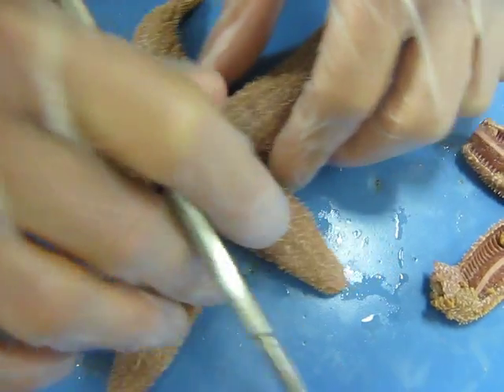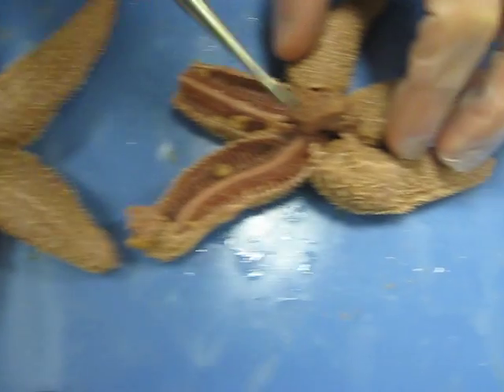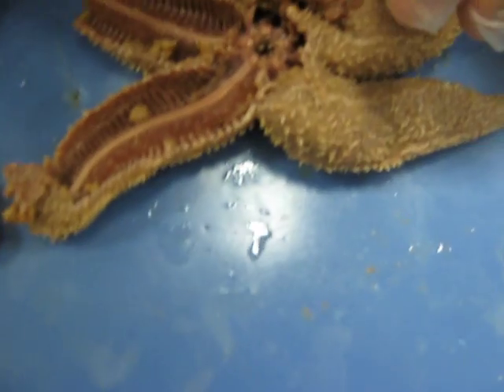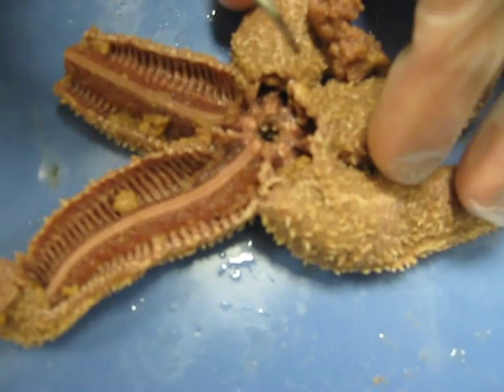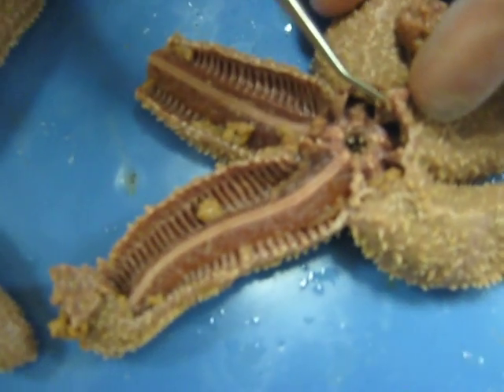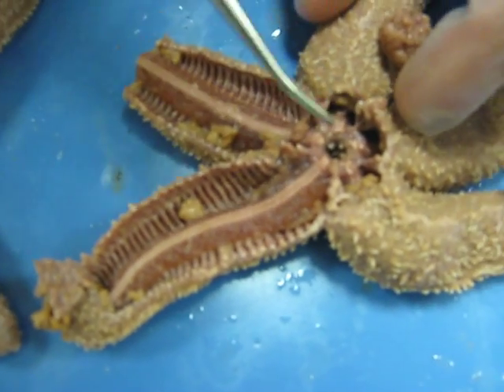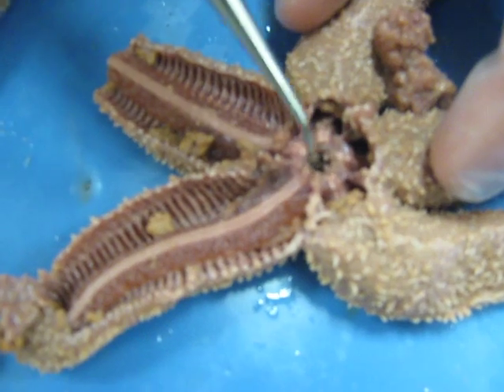And then when you remove that further, some things you can see: under the madreporite here there's going to be a white string line like this — that is the stone canal under the madreporite. And this is the circular canal here.